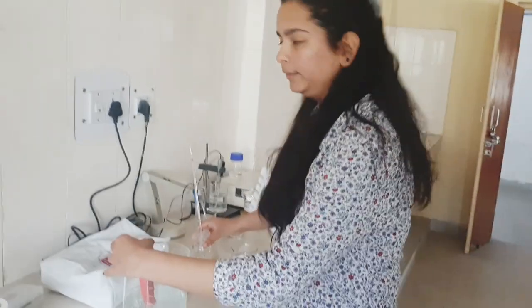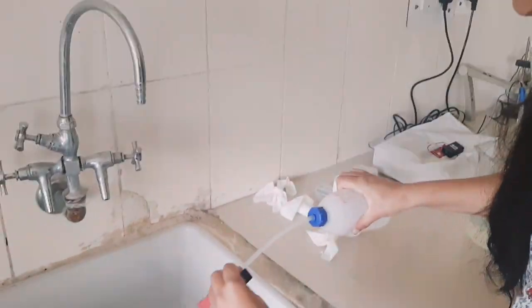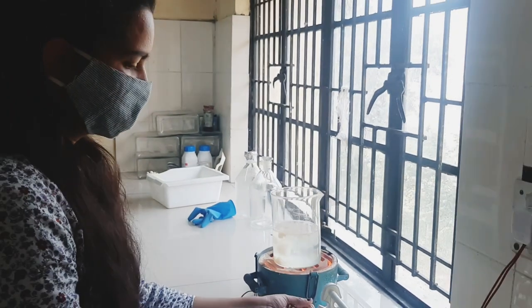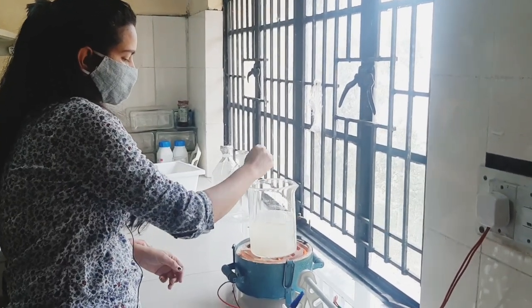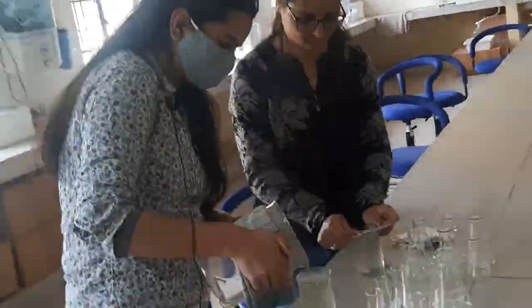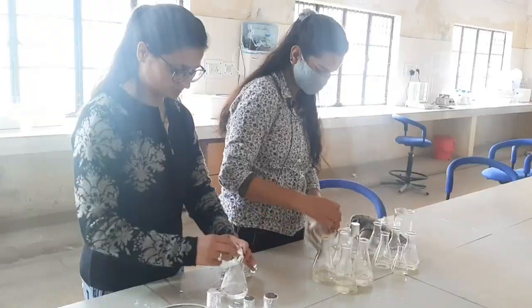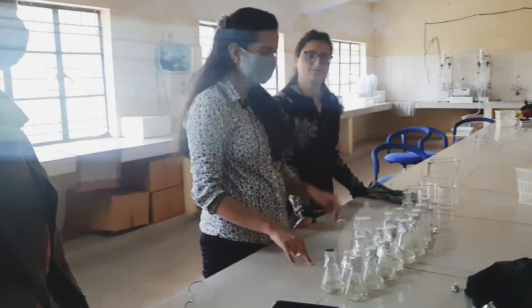If the pH needs adjustment, we add a few drops of HCl. We also add 8 grams of agar. Now we have to stir it. Now we pour it into a flask. Our MS Media has been prepared. Now we have to sterilize the MS Media — we will autoclave it.